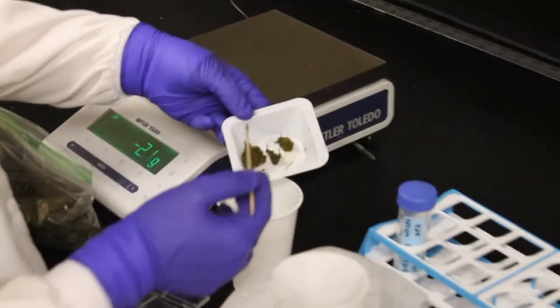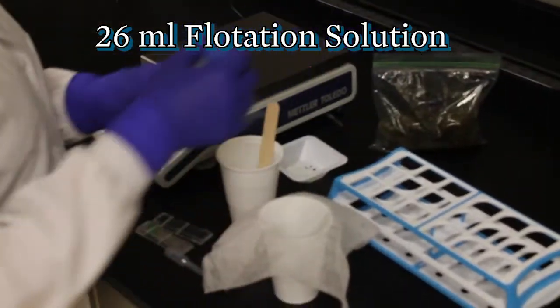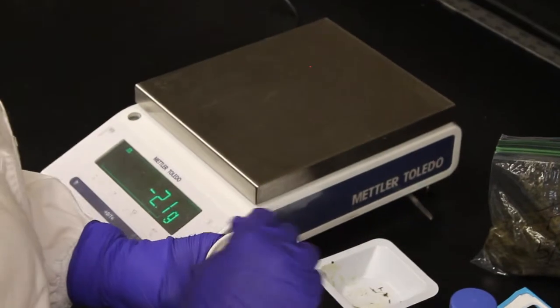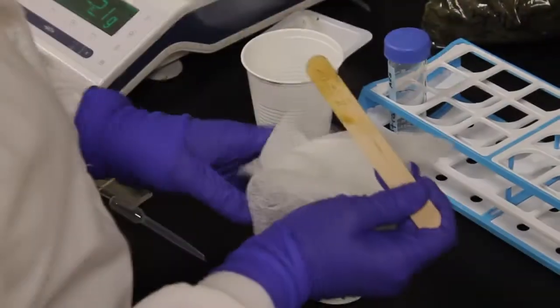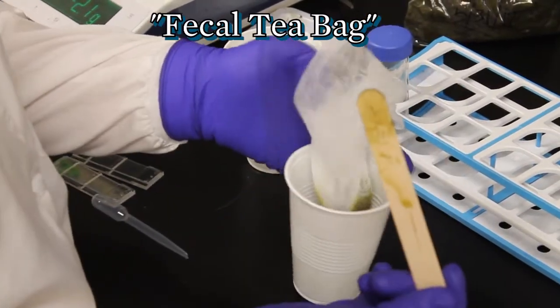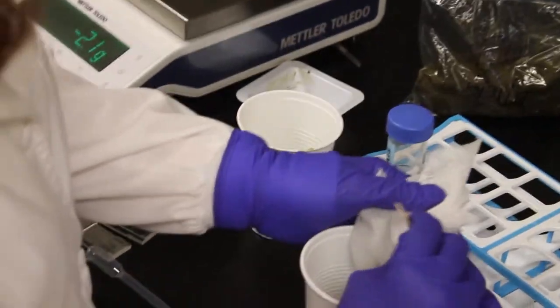I'm going to take them into my first Dixie cup, add in 26 milliliters of flotation solution, stir my feces and the solution, pour the feces into the cheesecloth. I'm going to make a fecal teabag, if you will, and using my tongue depressor, I'm going to press it up against the side.